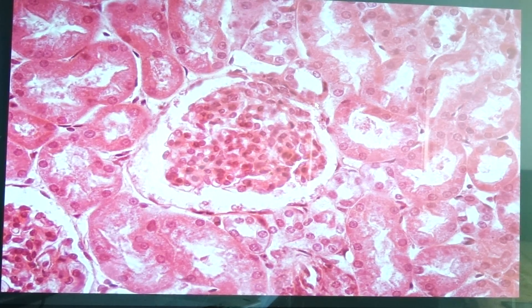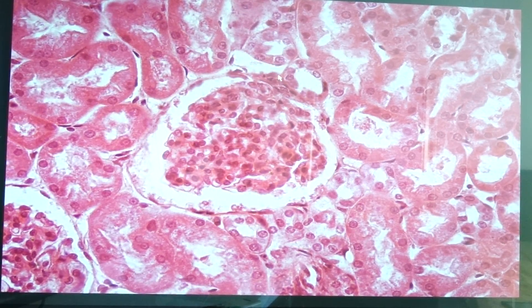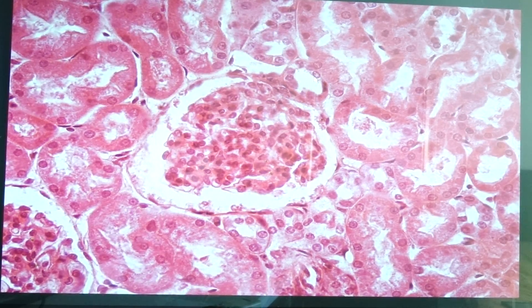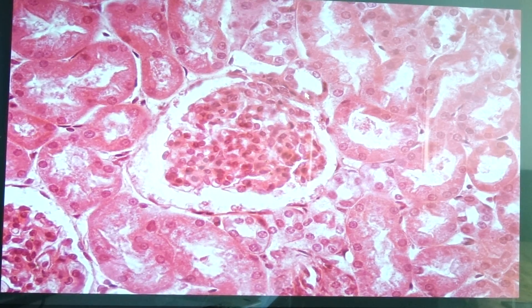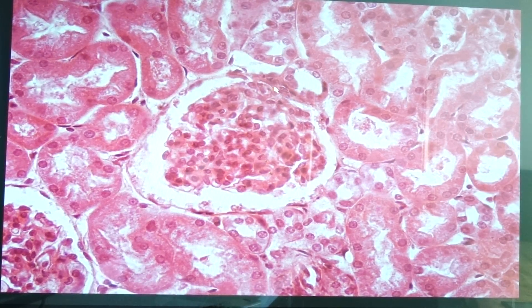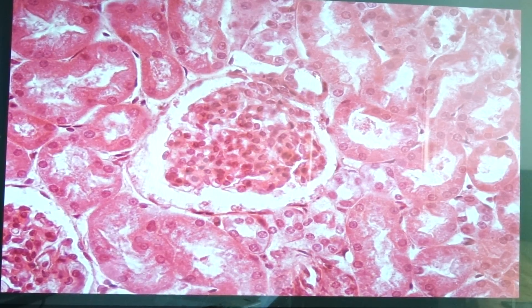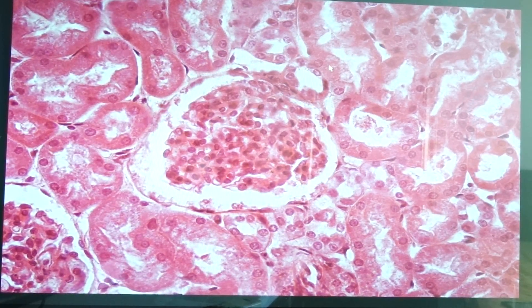So what would be the composition of the JG apparatus? The arteriole is present, and the cells that would be part of the JG apparatus would be called the JG cells. This is the distal convoluted tubule, and the cells that are part of the JG apparatus here would be called the macula densa. The portion of the glomerulus that would be part of the JG apparatus would be the extraglomerular mesangial cells. So this would be the vascular pole and this is the part of the JG apparatus.